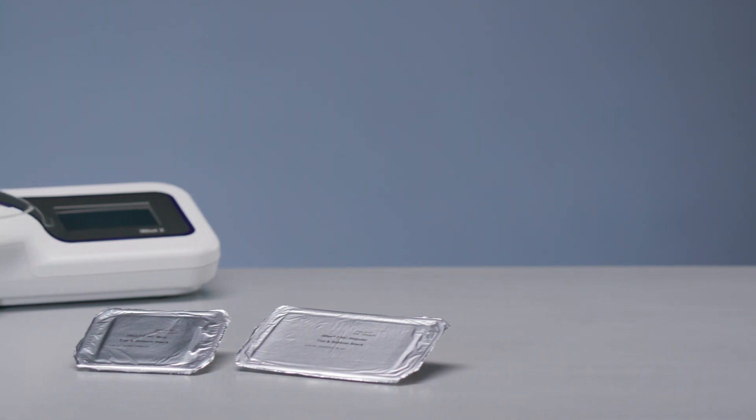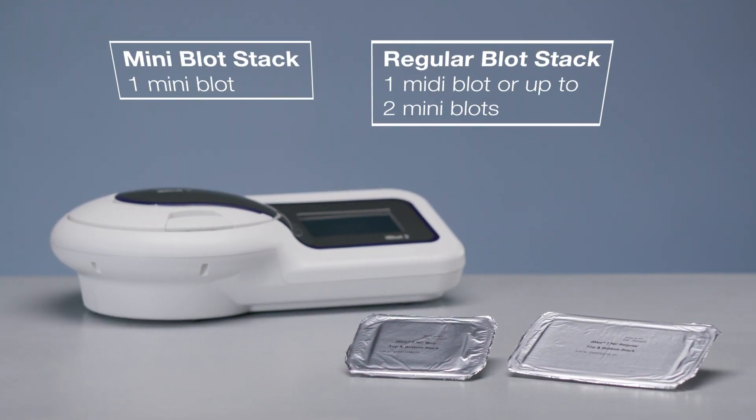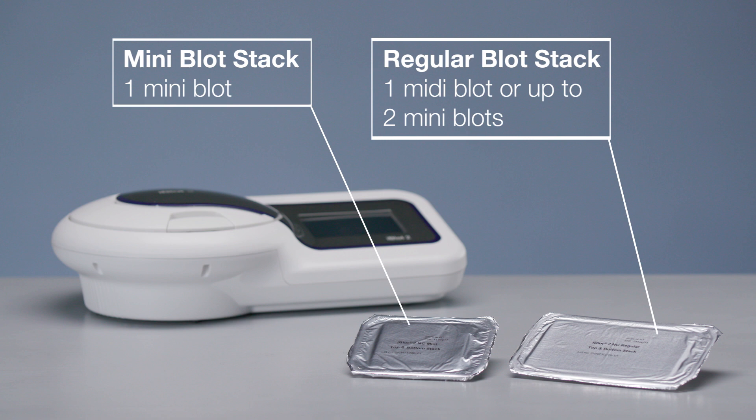Both mini and regular blot stacks are available. Mini blot stacks transfer one mini blot, while regular blot stacks can transfer one midi blot or up to two mini blots.